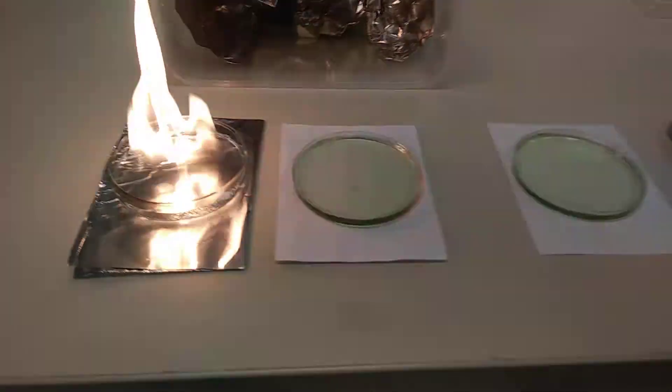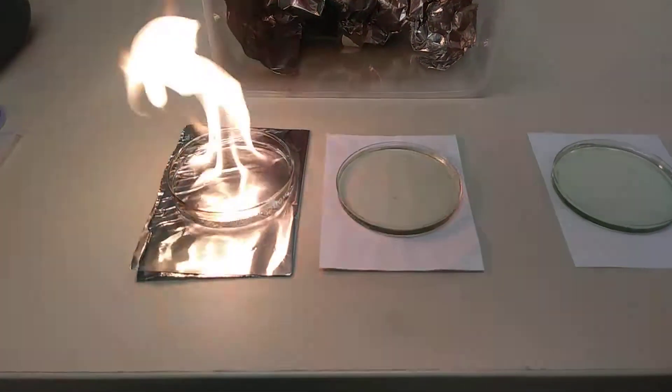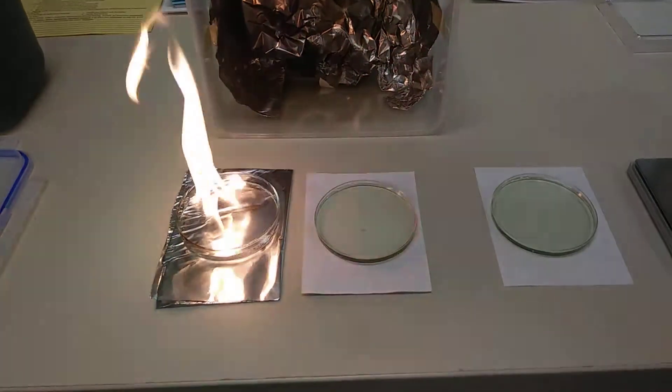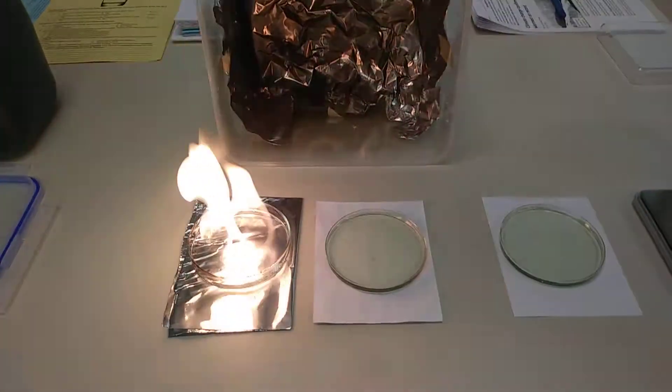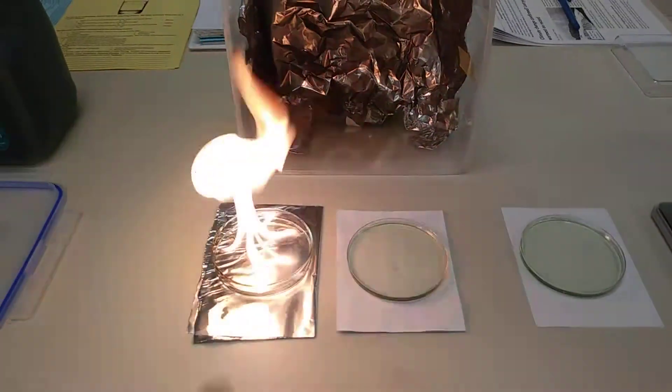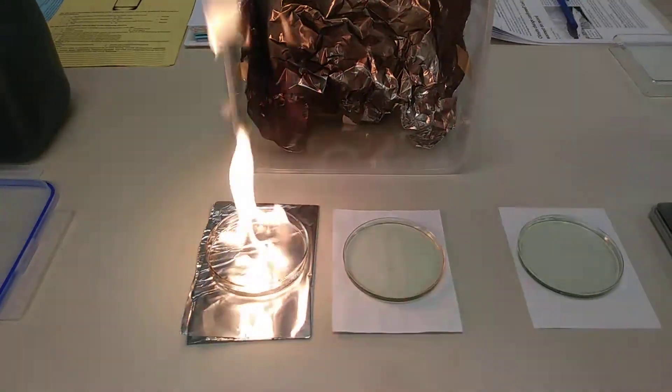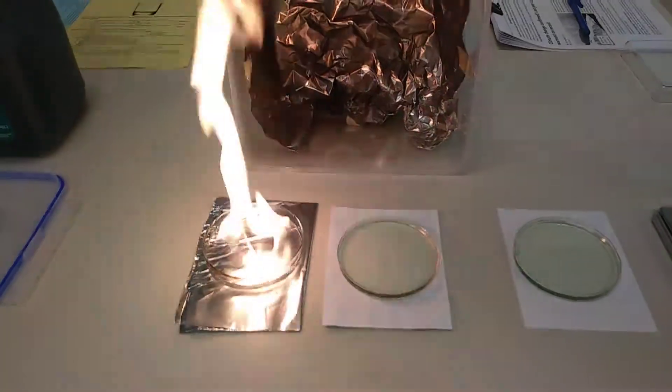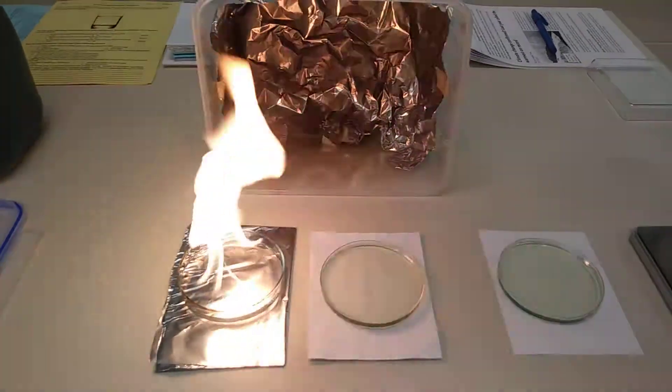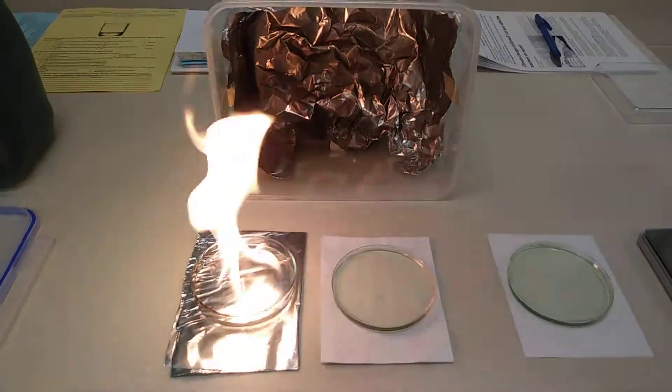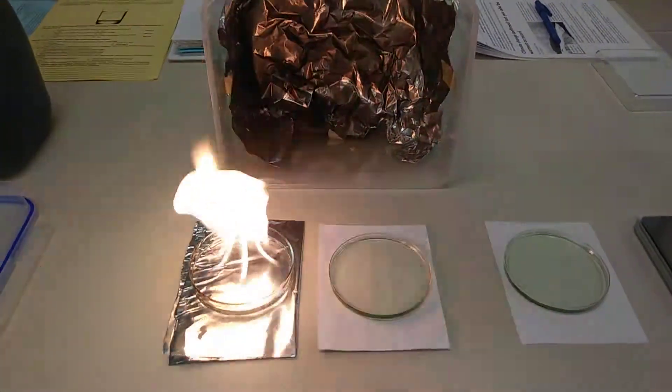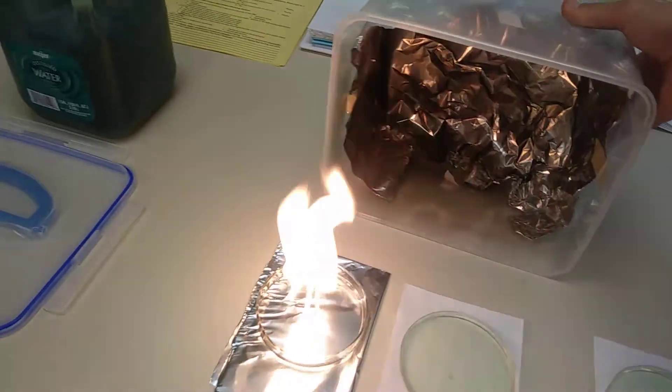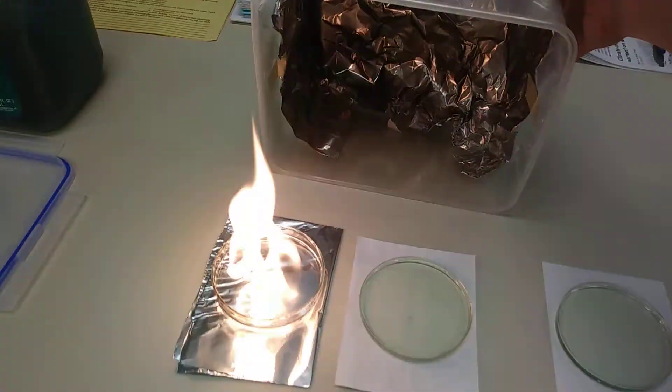So far, my BTB has not changed. The purpose of our BTB is that when we throw our fireproof box over these two, any gases that are released by this fire are going to be enclosed in that box, and they will be absorbed by the BTB. And depending on the color change of the BTB, that is going to indicate maybe what the identity of that chemical is, that gas that's leaving the fire right now. So I'm going to place our fireproof box over this, now that it's burned for a minute or two.